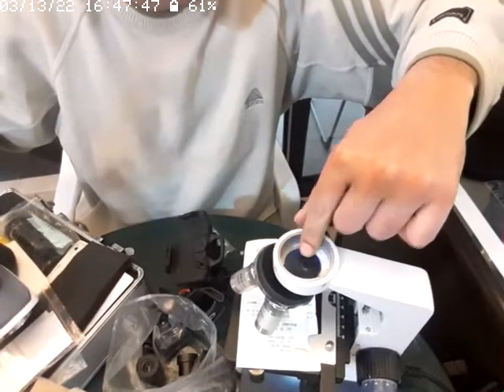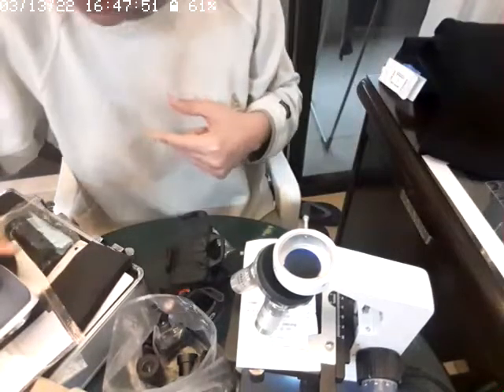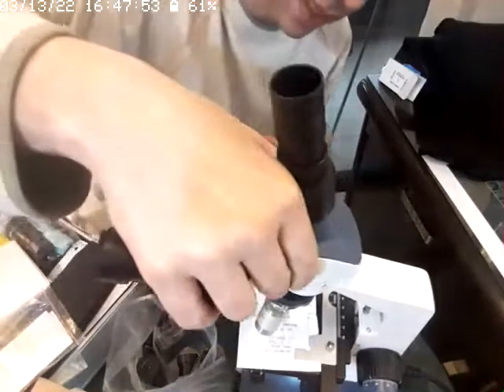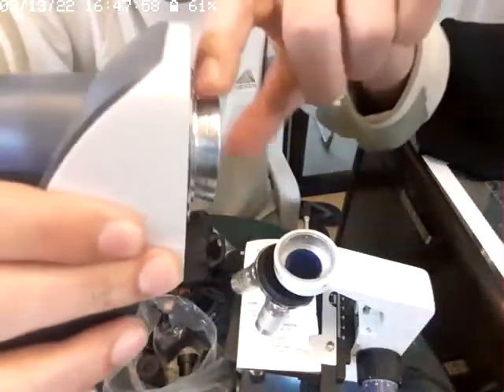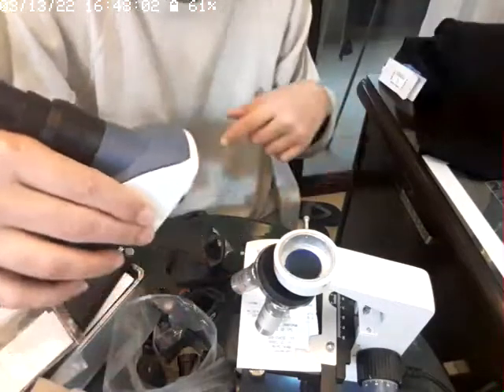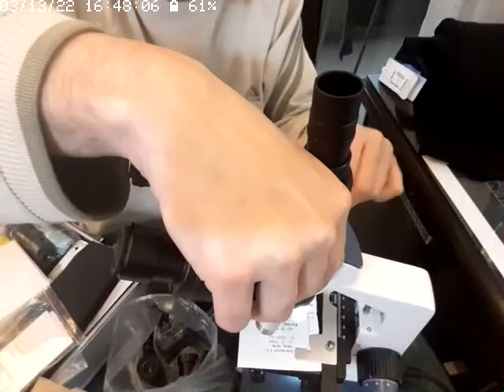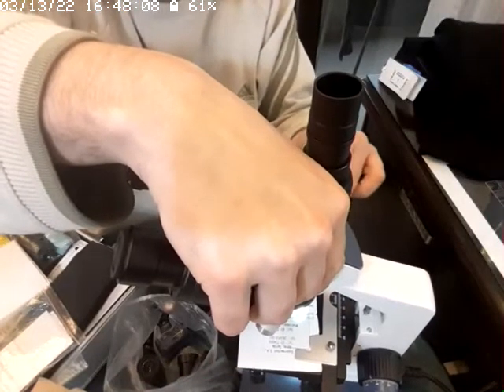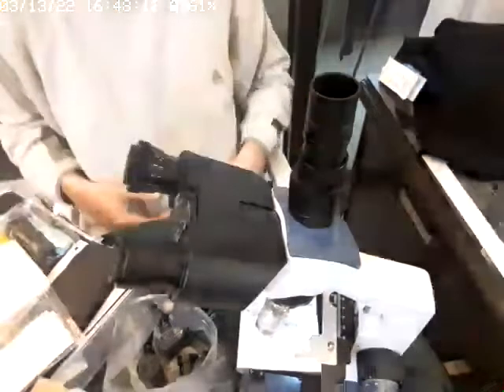There's no installation with screws and things like that. It's not as firm. So all you have to do is put this back again, and remember the side here, where the screw sits. This screw over here is the one I've used. And then I can just simply take a picture.